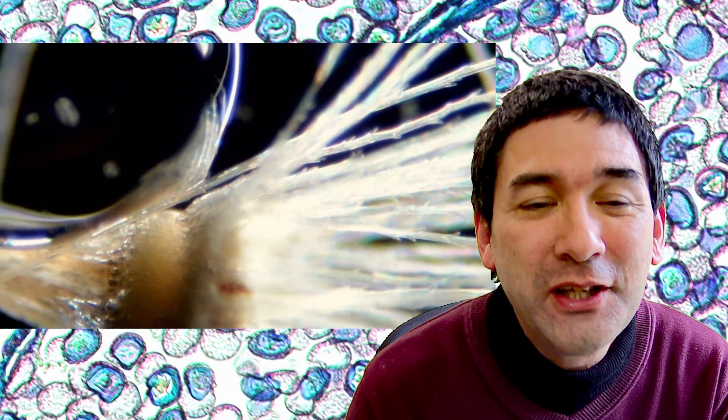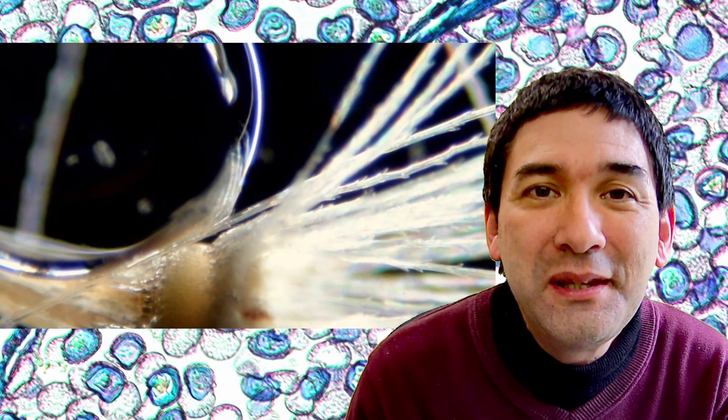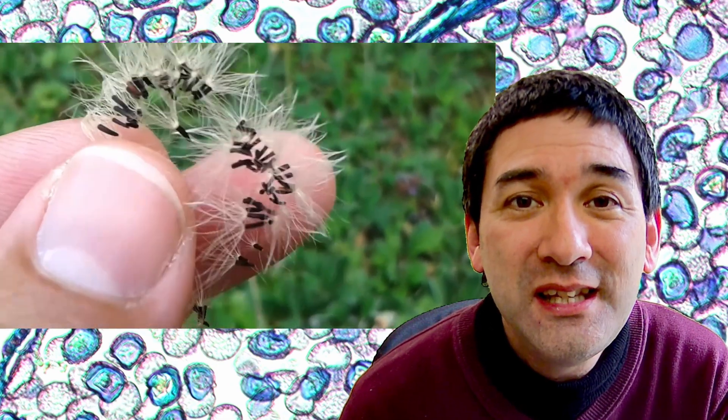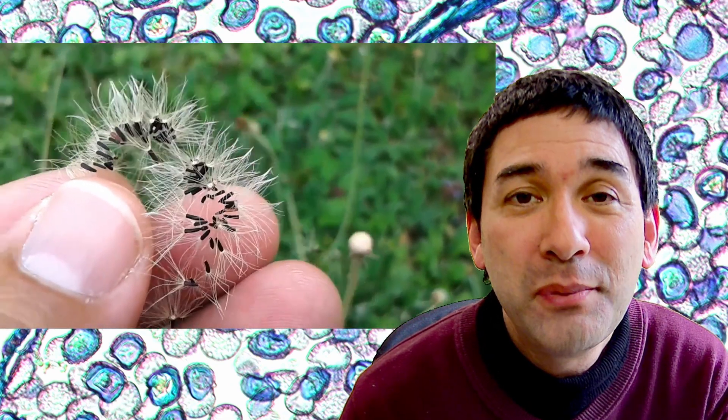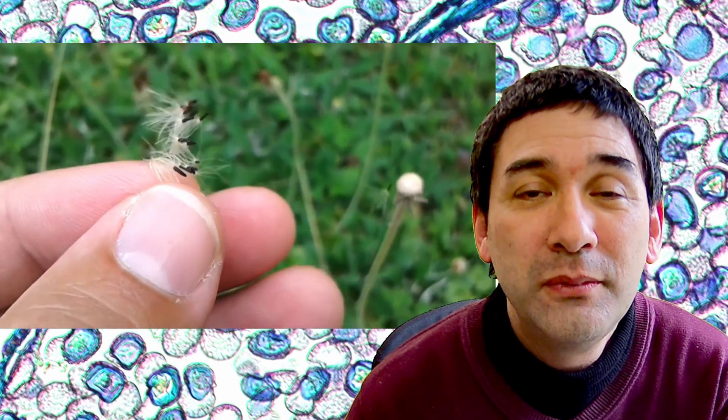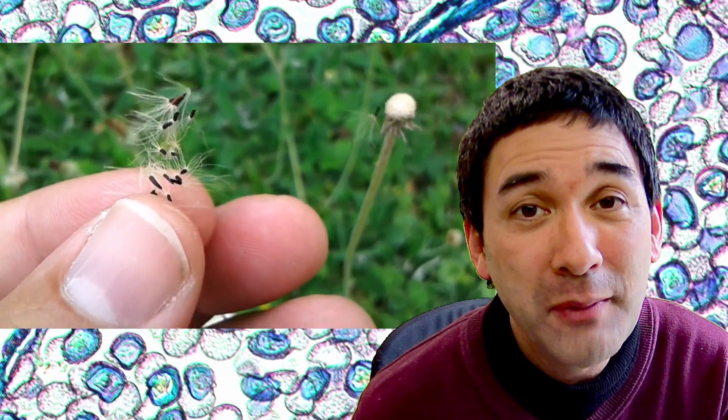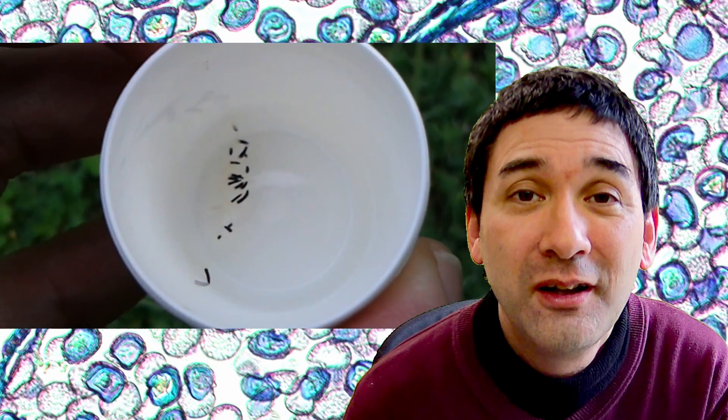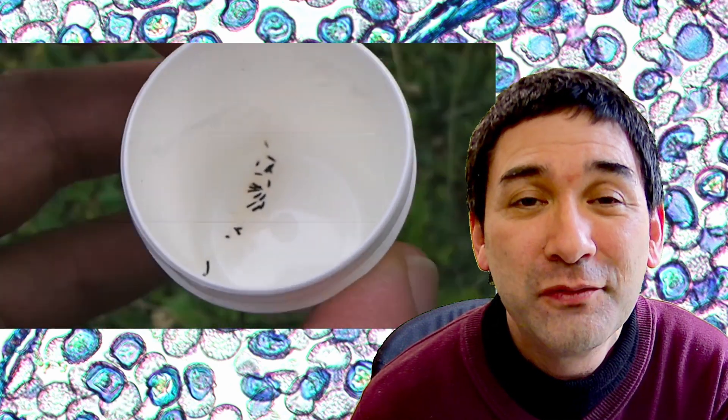The video is already running, but we're going to start at the very beginning. The very first video I made was about a dandelion. I put a dandelion under the microscope—must have been springtime—and took some seeds to prepare a wet mount showing how it looks under the microscope. At that time, I didn't add any voice comments, just music, which I'll leave out now for ease of understanding.